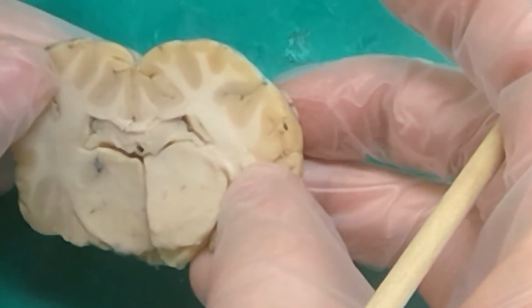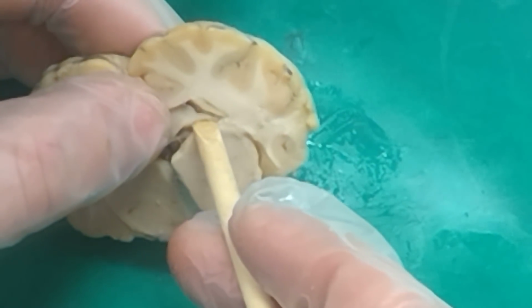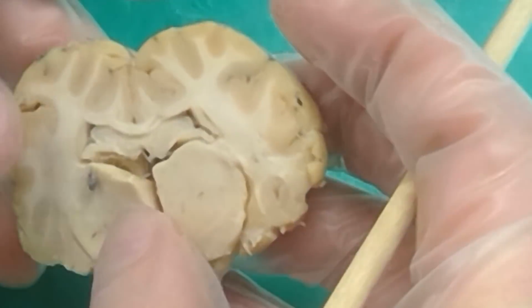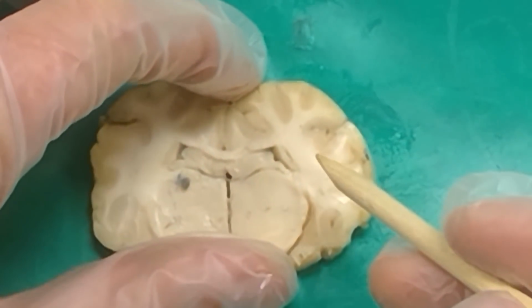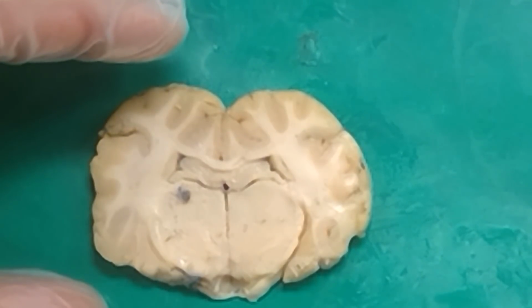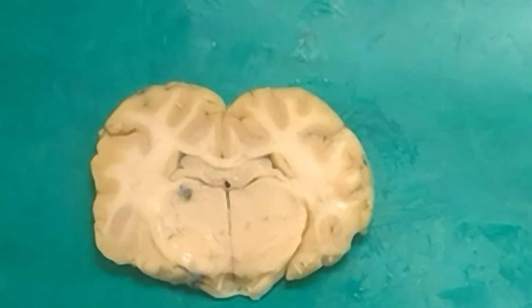Can you point to the fimbria one more time? Yeah, the fimbria on this piece are these fibers that we can see up here. They should be at both the top and the bottom if you can see the whole thing. Can't really on this cut, we can just see a little bit of them right there. So the hippocampus goes down on both sides. Yeah, so the hippocampus is shaped basically like this in the brain. So you've got this part that's medial and these guys stick out laterally.